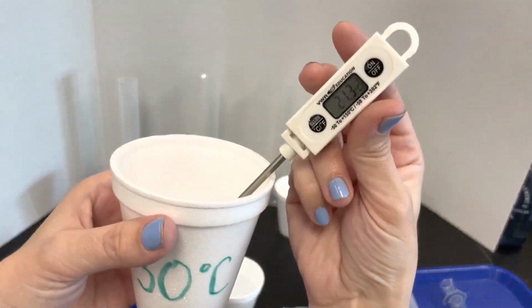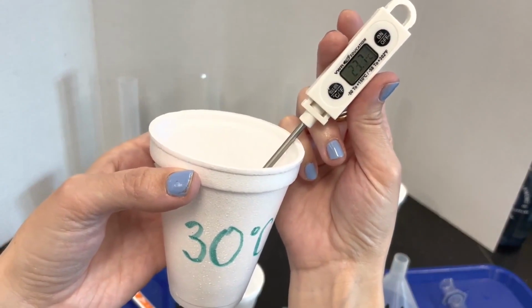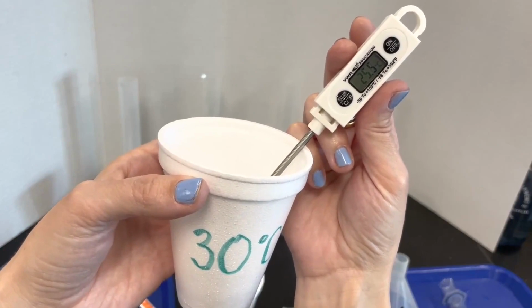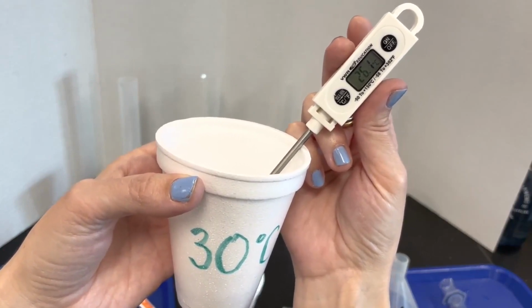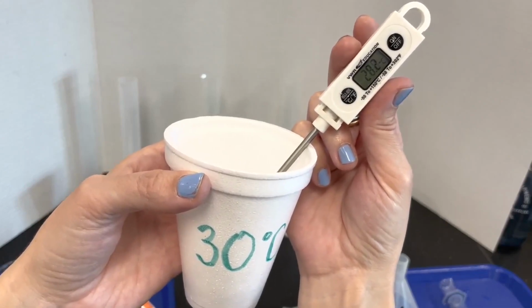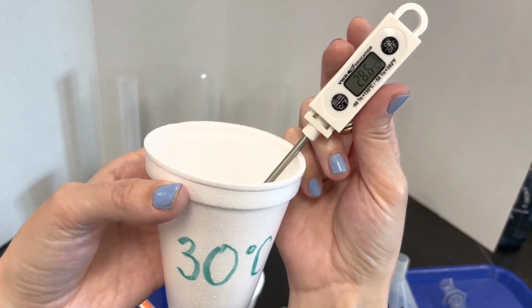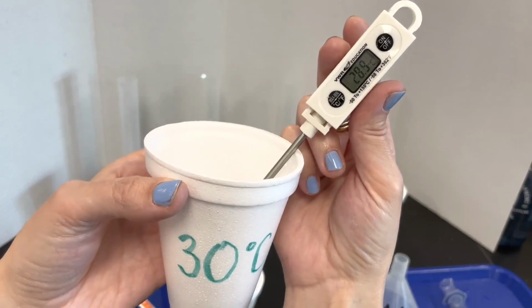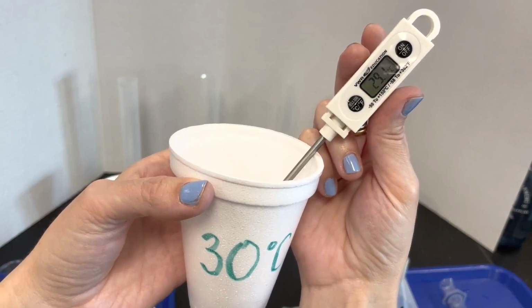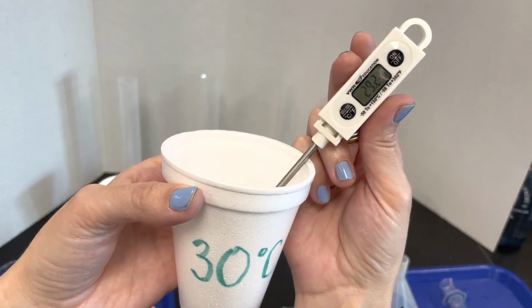Let's see if we can get to 30. Okay, 29. We'll call that 30.